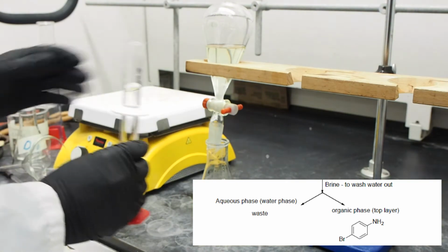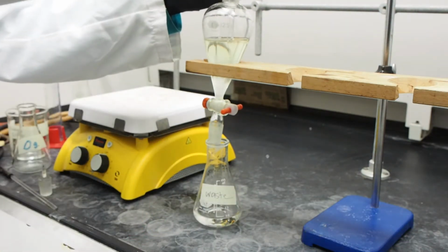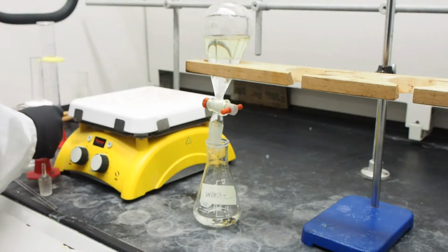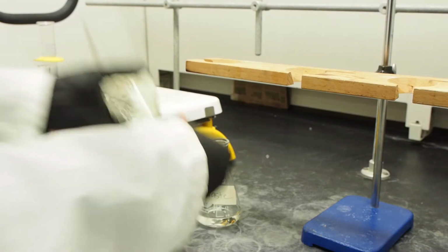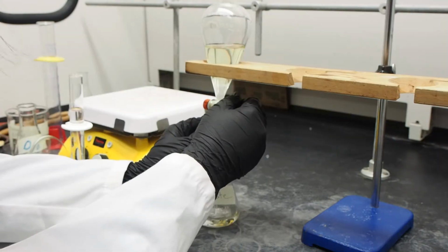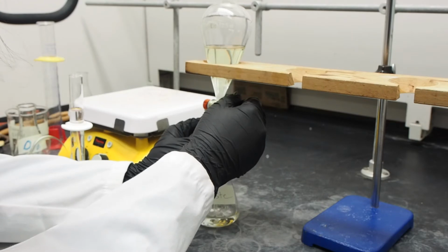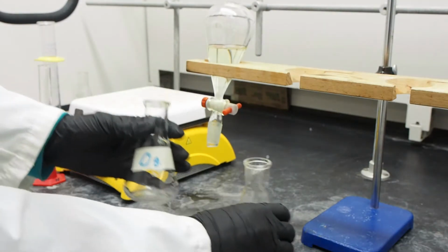Add brine, which is a sodium chloride solution, shake, then release pressure. Drain this to the waste flask. Swirl the separatory funnel to make sure that no water traces are left, as small droplets of water may become apparent when the mixture is swirled. Doing this will remove traces of water from the organic layer. Drain the last water drops, if present.